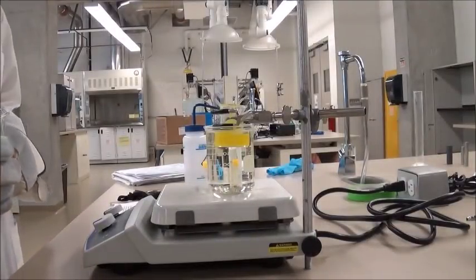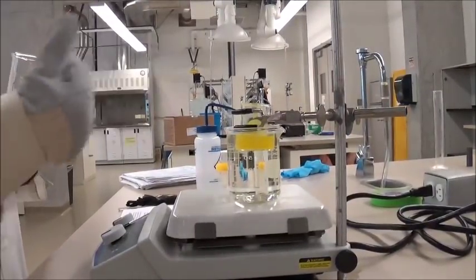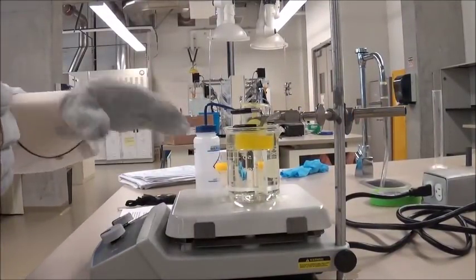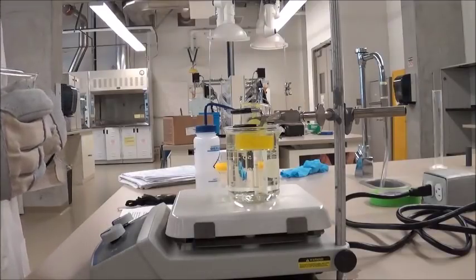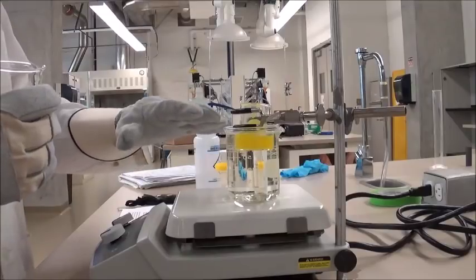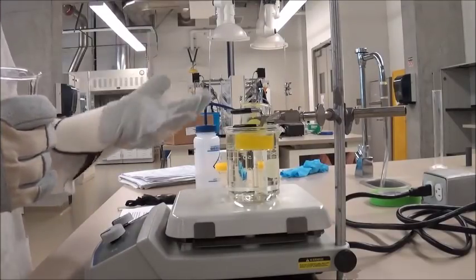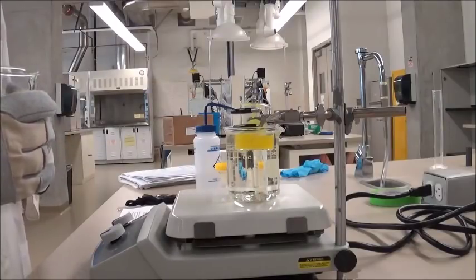Now you may also notice that while you're heating and reheating the 9-fluorenone, a lot of the water in the water bath keeps evaporating, and the water level decreases to below the height of the 25 milliliter beaker. This makes the process of melting the 9-fluorenone very slow.